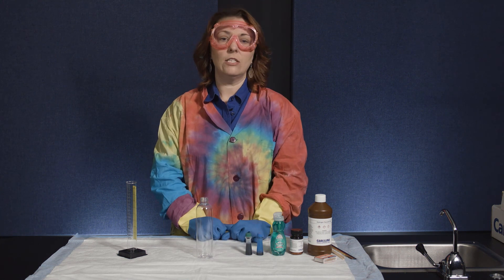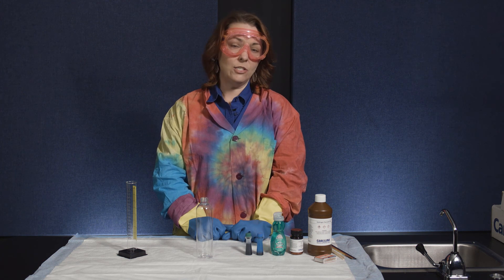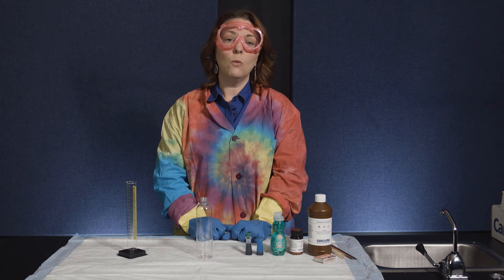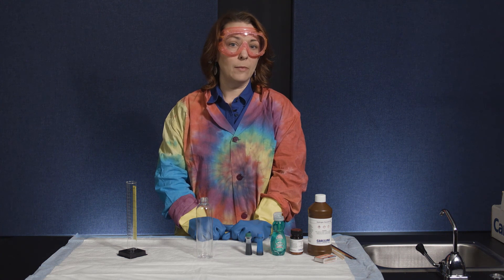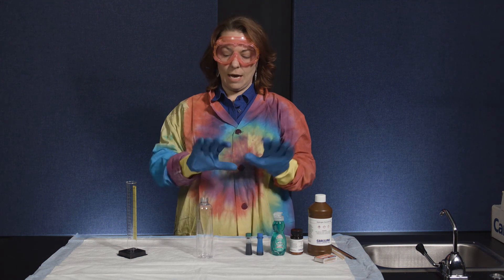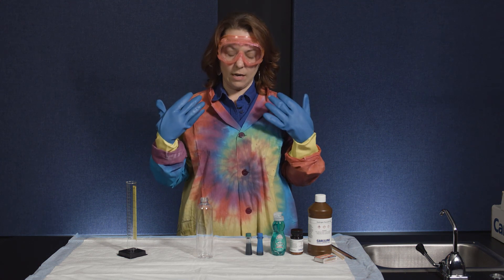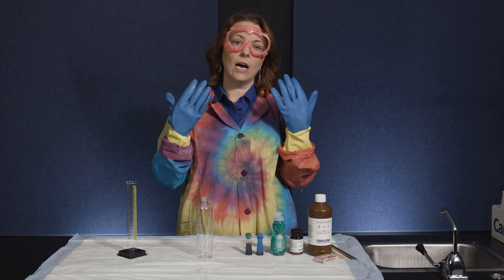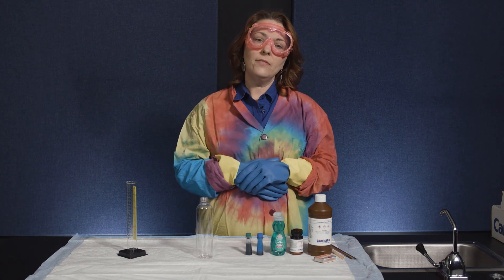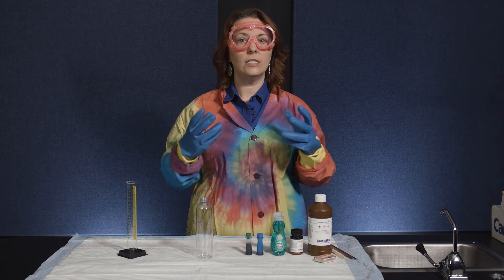Let's talk about the safety aspects of this demo. We're using 30% hydrogen peroxide which will cause pretty severe chemical burns if you get it on your skin. As you can see, I'm wearing really heavy duty gloves, a lab coat, and safety goggles.